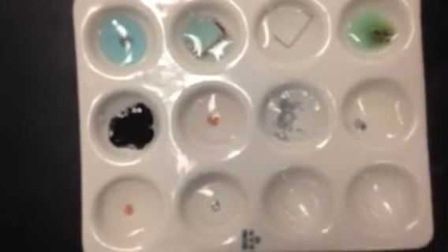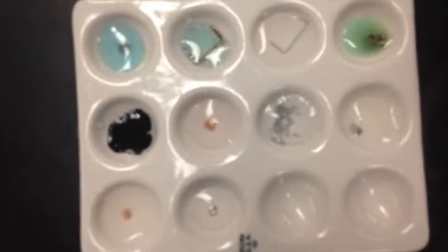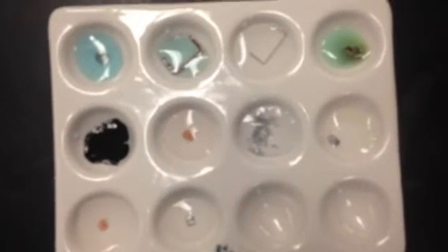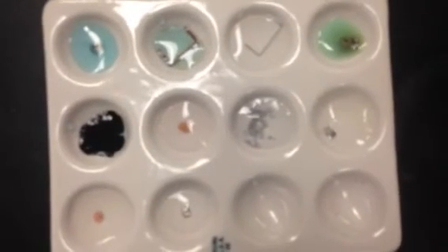If you did not observe any reaction, that means that the more reactive metal is already bonded, it's already part of the compound, and therefore nothing's going to change. And so in that case, again, if there was no reaction observed, the more reactive element is already a part of the compound, and that's the one you should circle. And again, it's the metal in the compound, not the whole compound name, because we're looking at just one species in the compound being replaced.